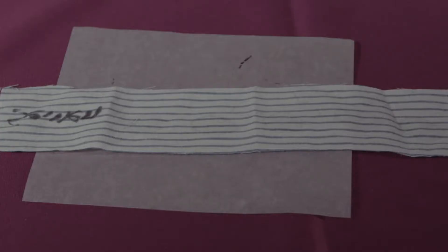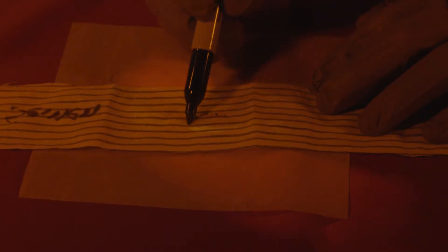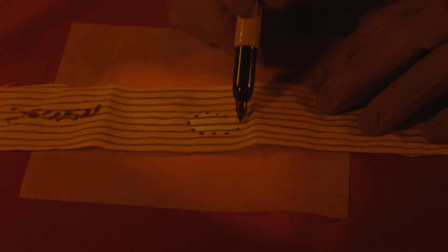Items are initially examined using an alternate light source. Any apparent stains can be circled and further analyzed for biological fluids, for instance seminal fluid using AP mapping. Mapping for saliva is accomplished in a similar manner.